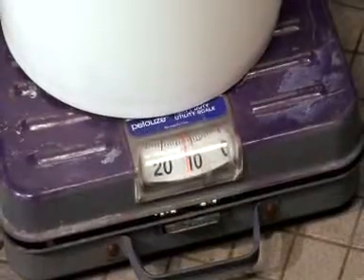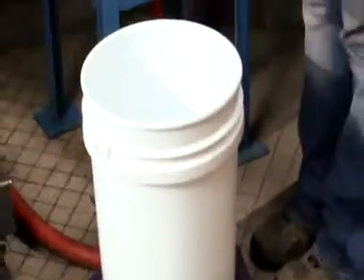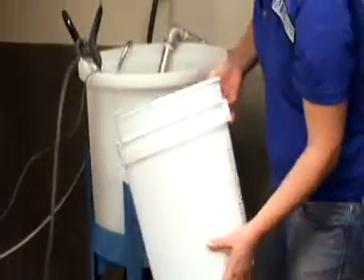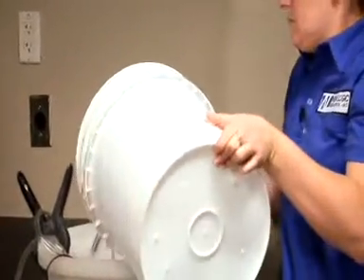Before beginning the membrane selection study, you must first pre-screen and weigh approximately 15 gallons of your feed sample. If possible, use a 100 mesh pre-screen. Once you've pre-screened and weighed your feed material, pour the feed material into your feed tank. You'll need approximately 15 gallons to complete this section of testing.